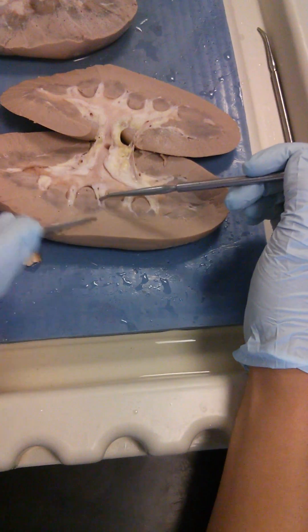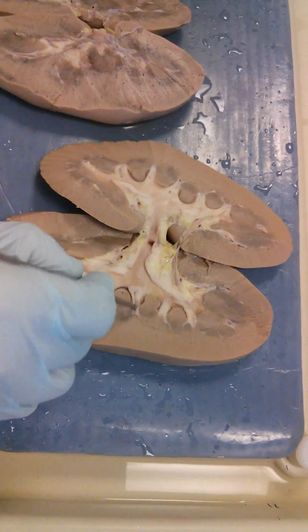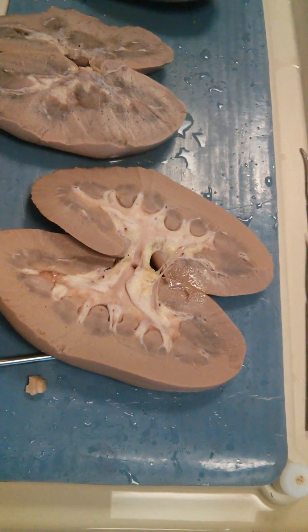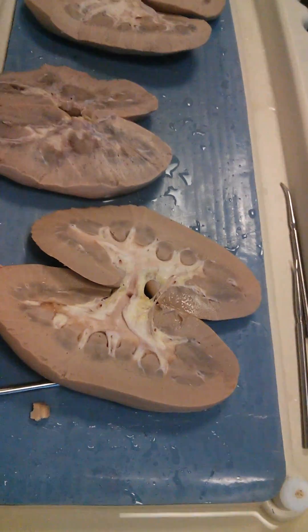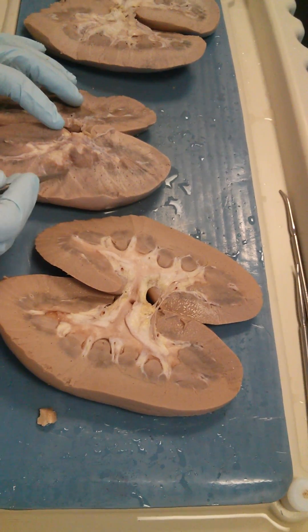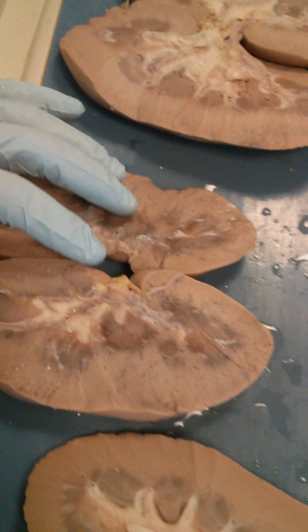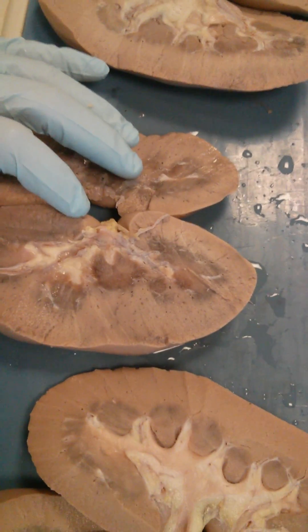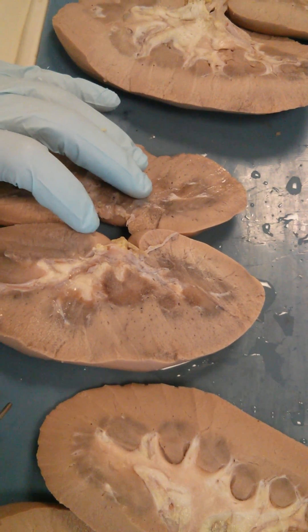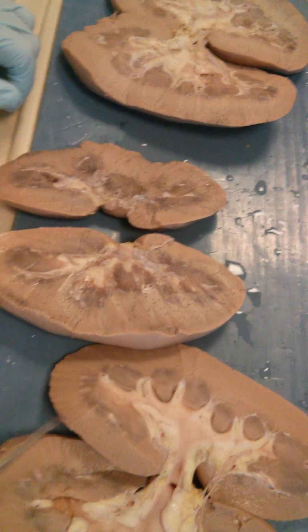These spaces here are the renal columns between the pyramids. The spaces go deeper — there is another calyx opening there. Remember, the kidney is three-dimensional like a globe that has been flattened. These pointed tips of the pyramids are called the renal papilla — papilla means nipple — and they project into the minor calyces.